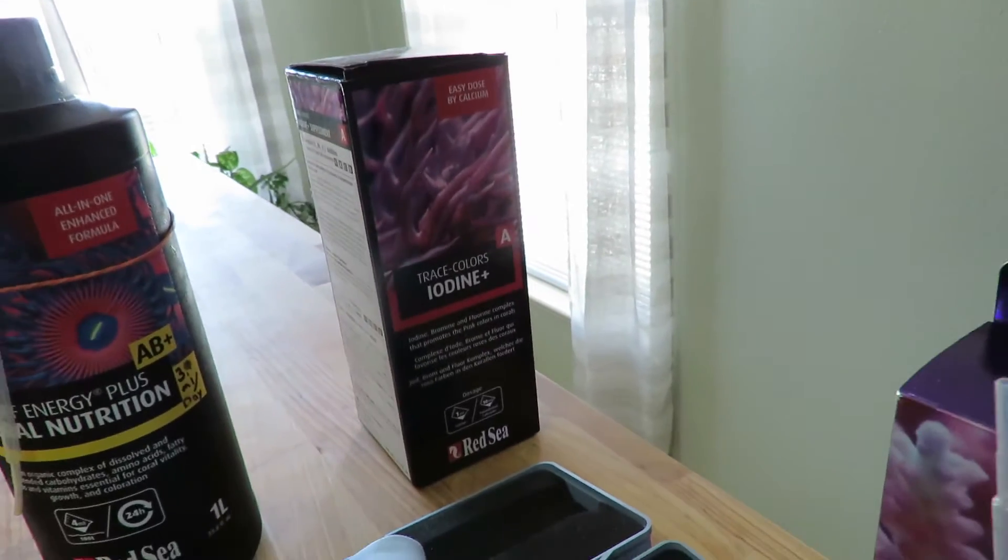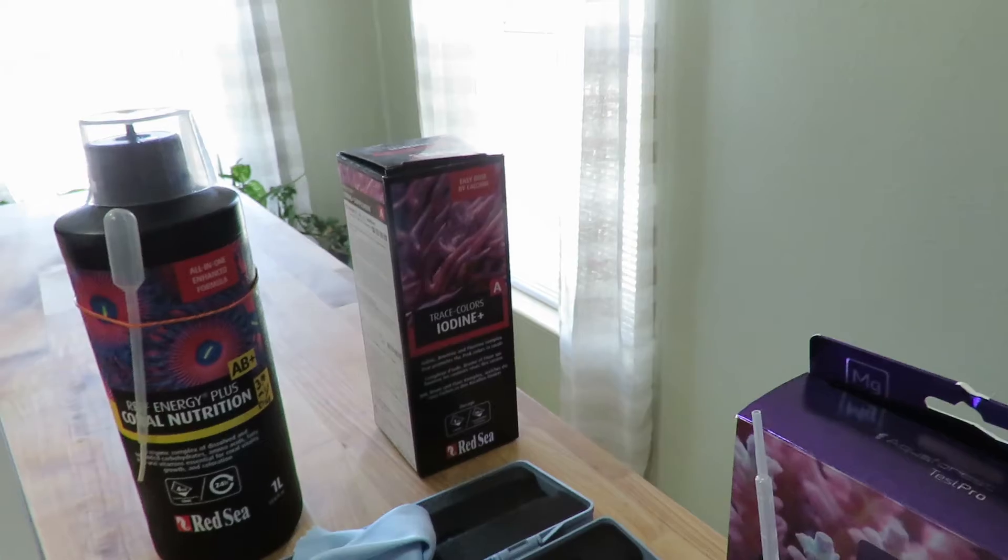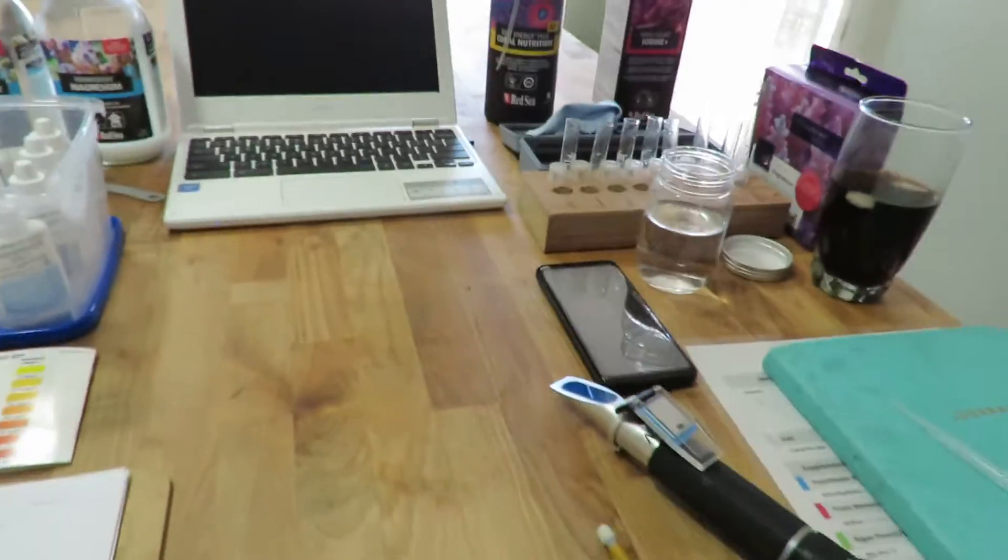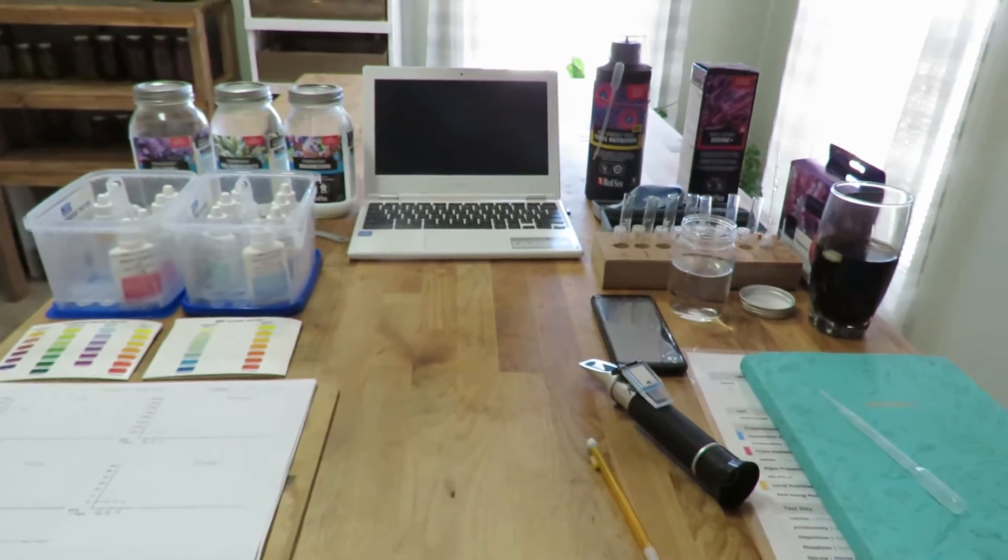So the other thing that I do dose is I do the iodine. That way it helps with your shrimp and stuff in order to shed and I do the coral nutrition. So anyway, that's what I'm doing now and I'm going to go ahead and test everything up.